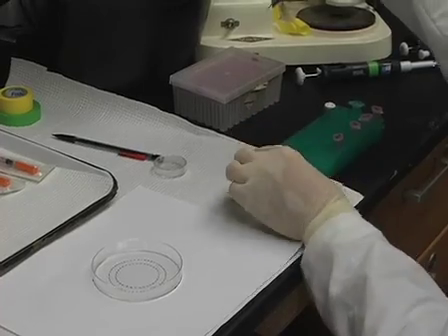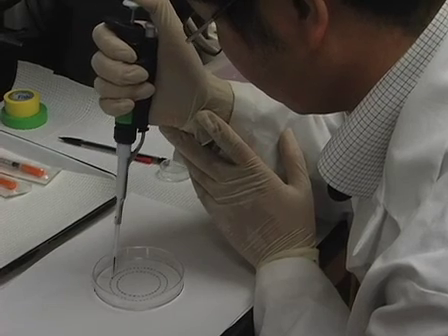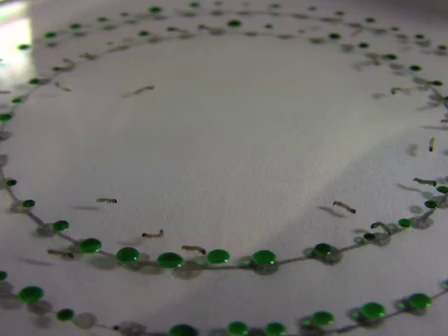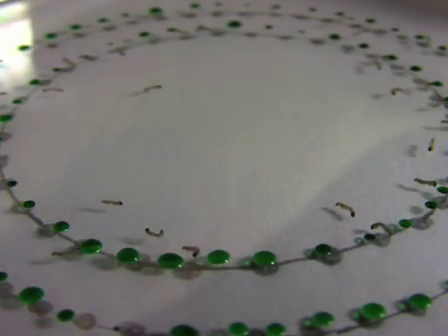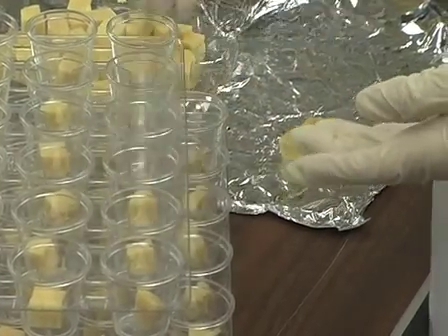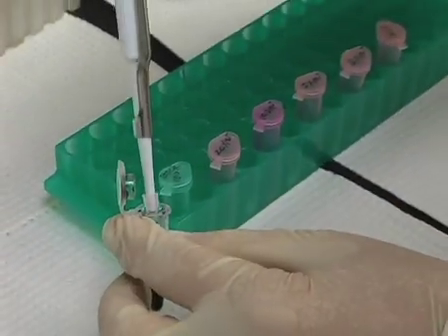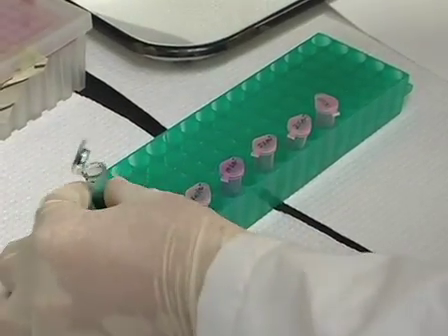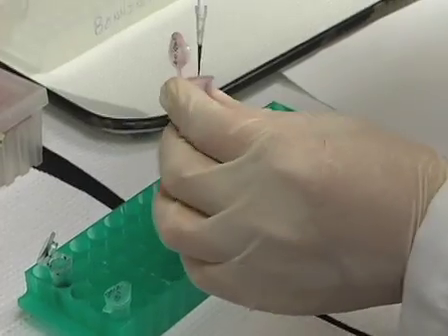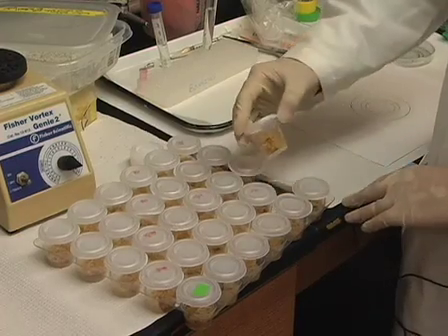Droplet feeding bioassays can be used for the determination of the lethal dose of a Baculovirus and survival time of Baculovirus-infected larvae. Early instar or neonate larvae are generally used for this assay. Before starting, make sure you have diet cups with the appropriate diet on hand. Also, prepare the appropriate virus dilutions. Include green food coloring dye to a 4% concentration by volume. In order to determine the lethal viral concentration, the dilutions should give a range of mortality between 1 to 99%. Preliminary bioassays may be required to determine an appropriate range of virus concentrations.